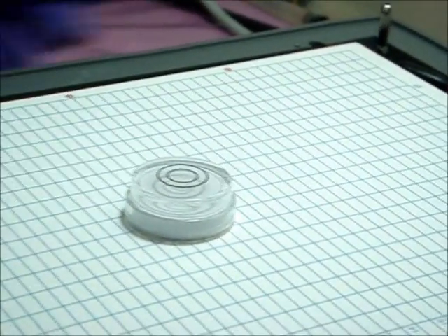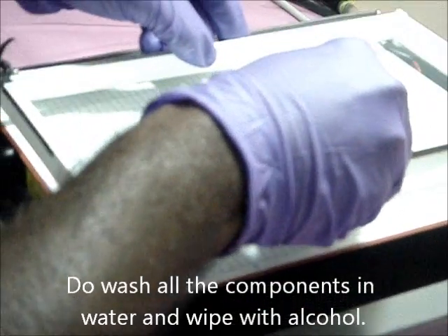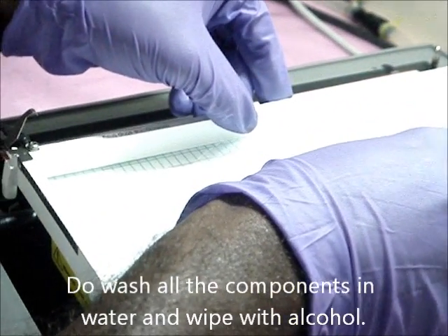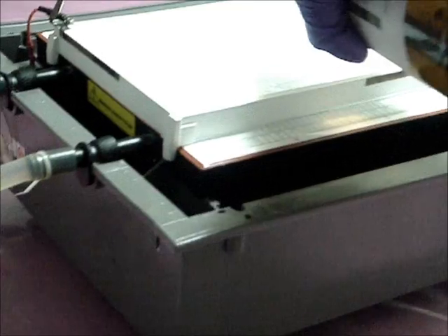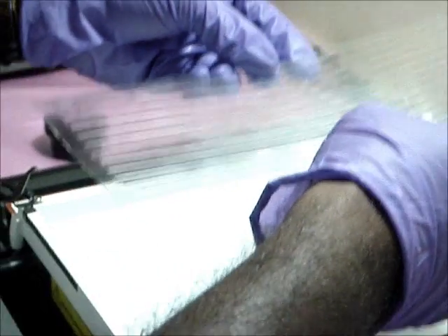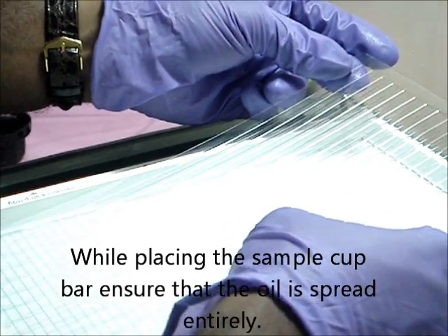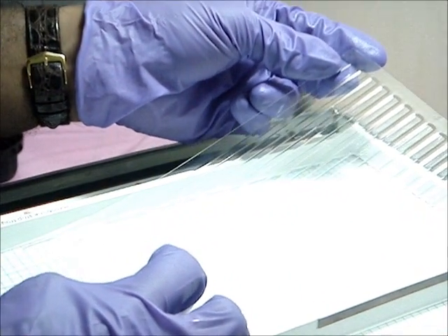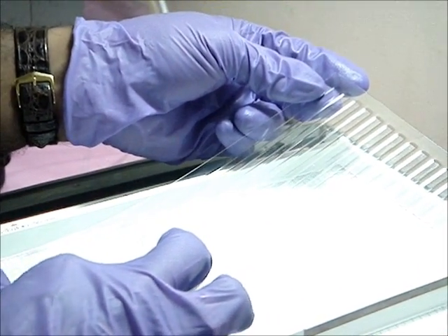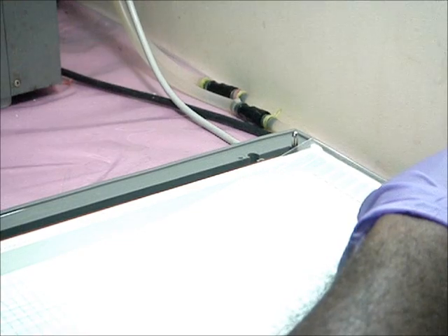Level the apparatus. First place the immobilized strip aligner. Fill the strips with mineral oil. Over this, place the sample cup bar.